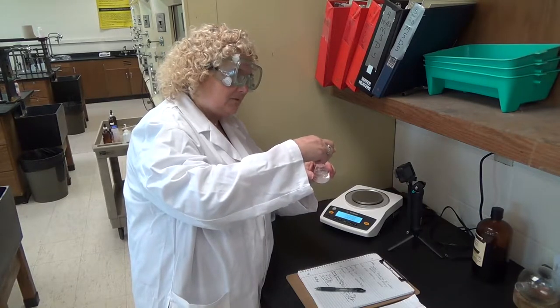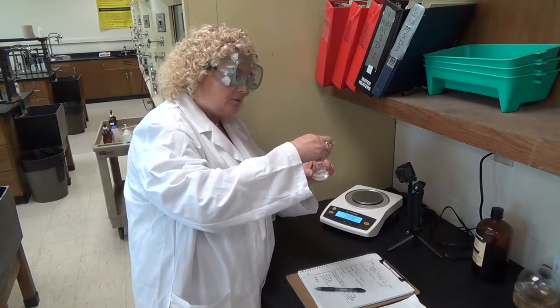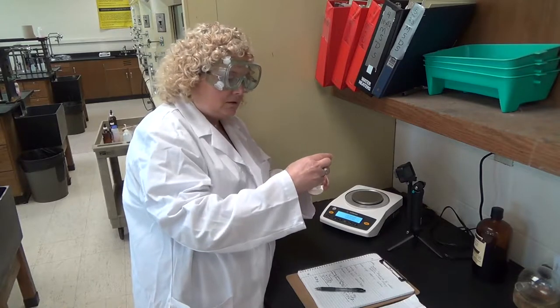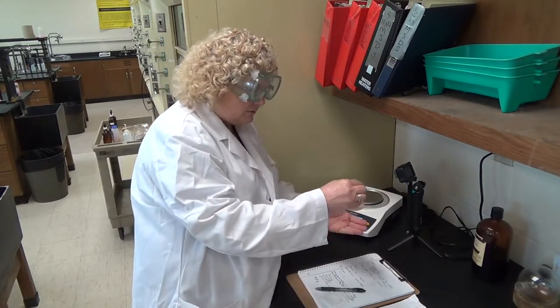Ordinarily, I would be using a funnel. I've got most of it. Swirl it around.